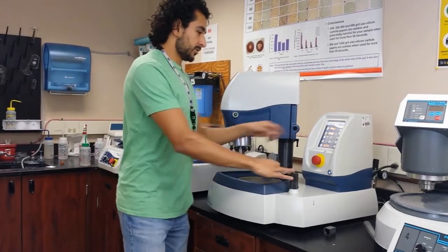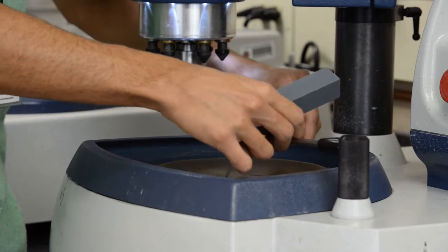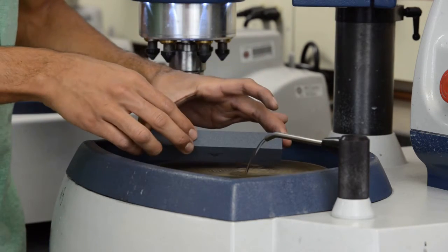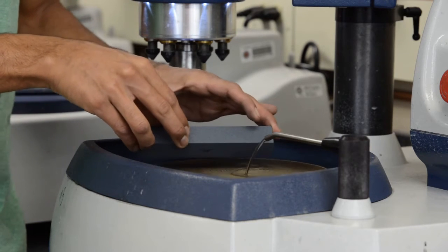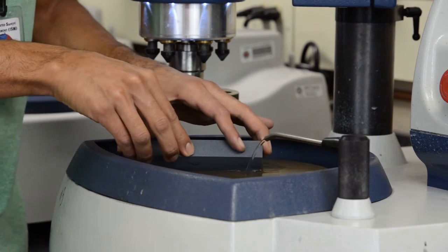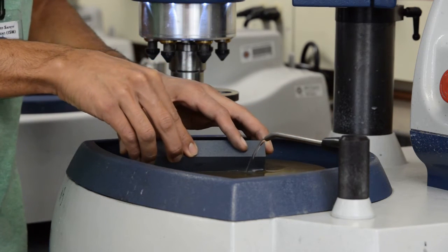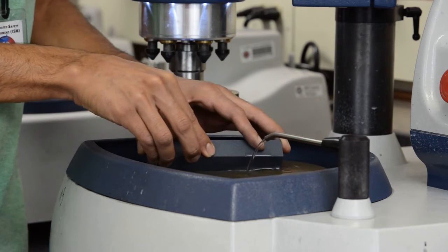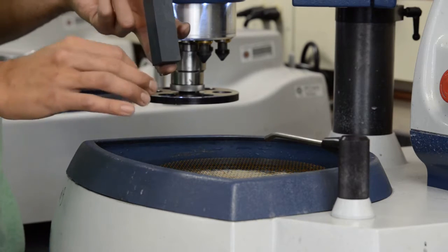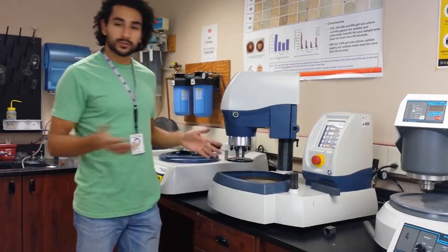I'm going to move the head out of the way, turn this on and the water on. The pad is nice and wet. I'll use the stone and put it on top — you can use the edge so it applies a little more pressure. Don't apply too much pressure because this is actually removing some of the clay and some of the diamonds. You don't want to overdo it. I'm applying a fair amount of pressure — about a pound — just letting this go for about 30 seconds. That should have removed a layer of dulled diamonds and revealed the sharper ones underneath. So it's ready to polish for about five minutes.